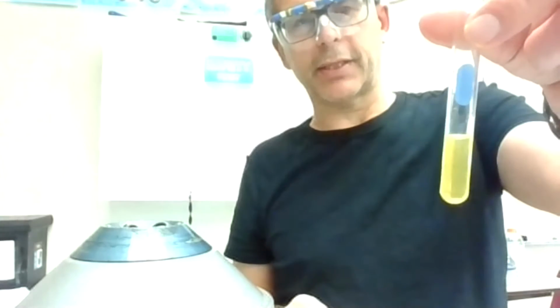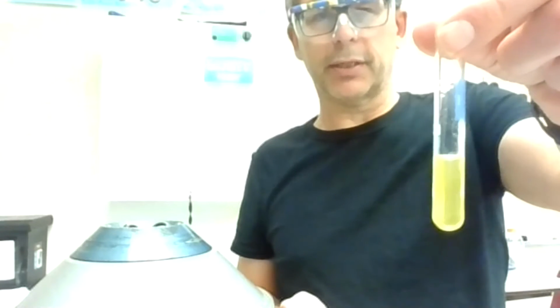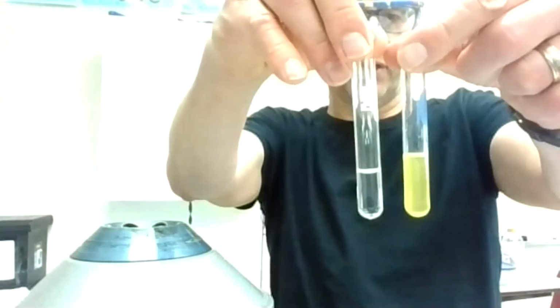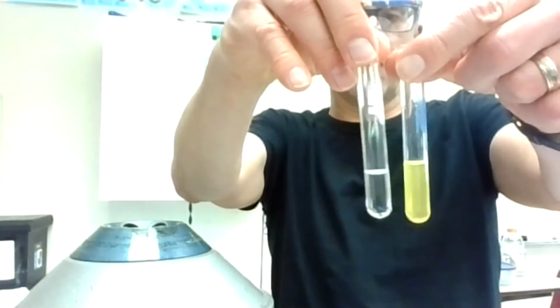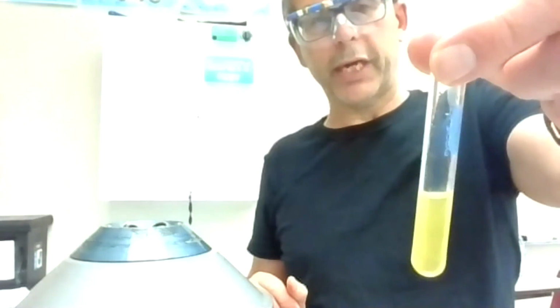It was pretty clear when I added it, but it's starting to fog up. I'm seeing this pretty faint, but now it's starting to fog up the sides of the glass. I can't really see through it very well. And it seems like it's crystallizing outside. So just trying to give it a little bit more time. You can see how that is compared to a clear solution. I know you've got the yellow color there, but it's really hard to see through that, where before we could see through that yellow color. So it took a little bit, but it's a weak test, and it does look like it's fogging it up enough for a positive test for that third step right there.